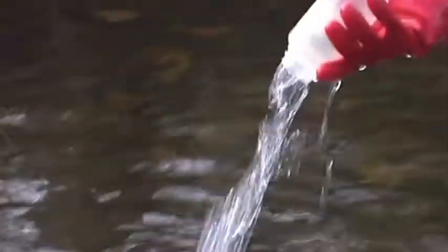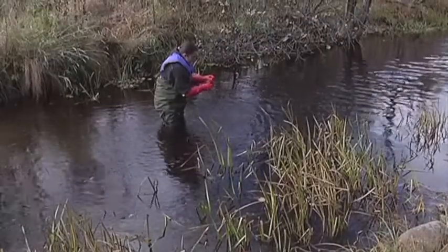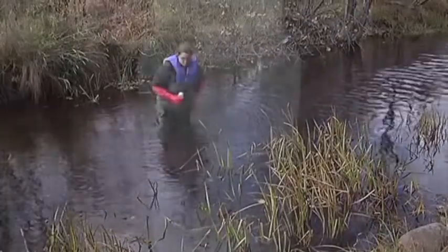Repeat the previous steps 2 times and then fill the flask with the required amount of water. From a scientific standpoint, it would be preferable to take a single water sample that you use for all the different parameters to be measured.